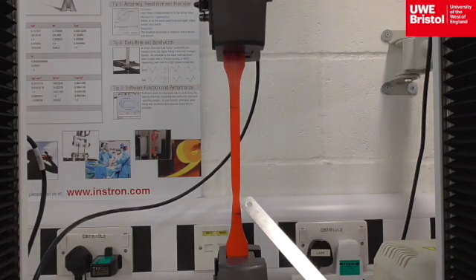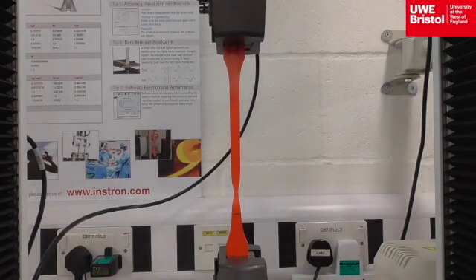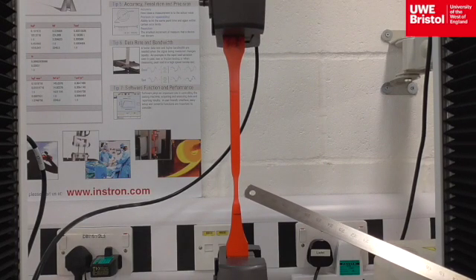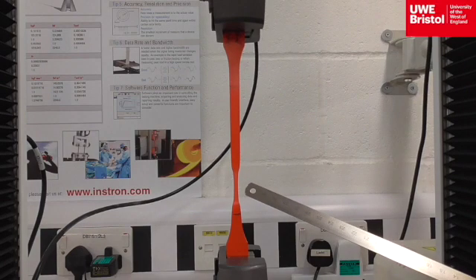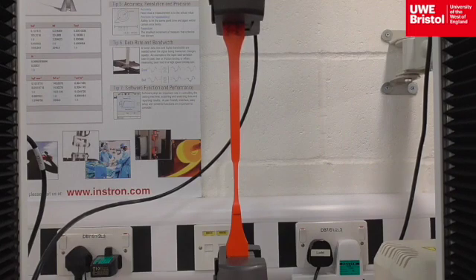For high-density polyethylene, some stress necking is observed here. With this polymer, this indicates that the fracture is most likely to occur here. The area is lightening in colour. Therefore, for high-density polyethylene, it will stress neck and stress whiten before failure.